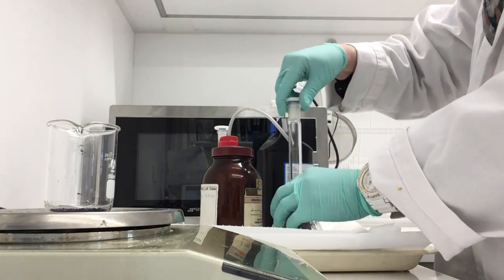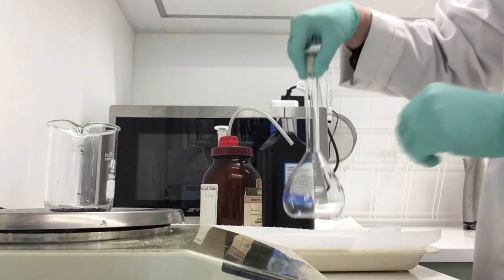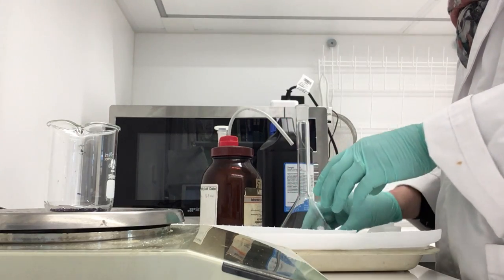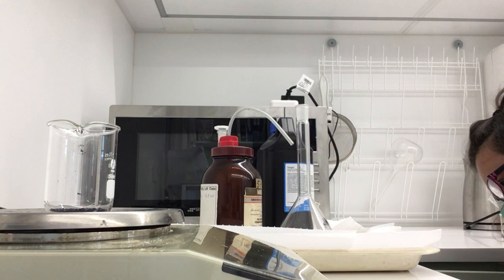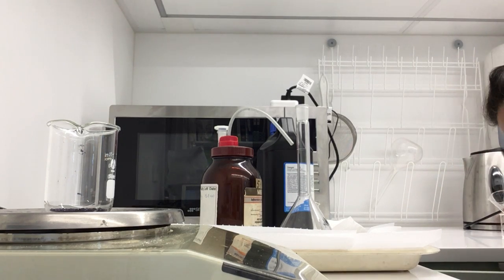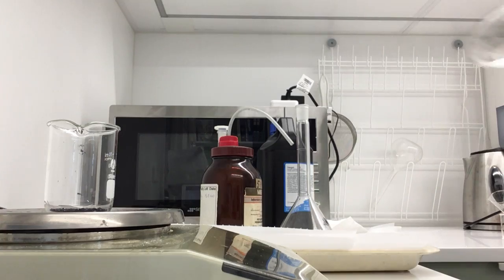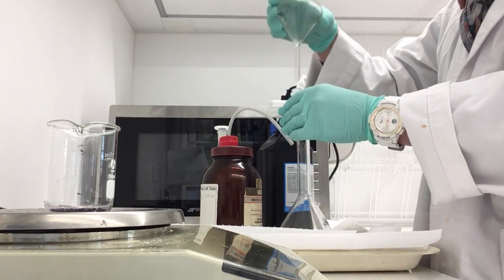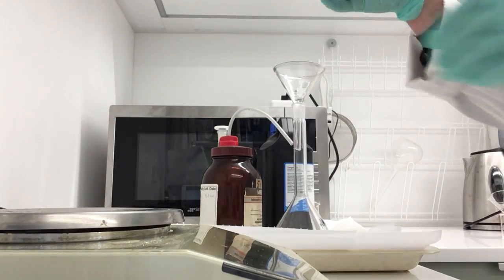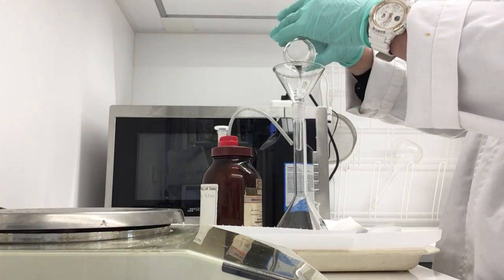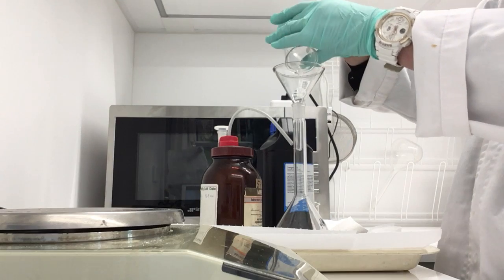So we're now going to put that into our standard volumetric flask. A little bit bigger, a small funnel. Okay, we'll use a funnel to make it easier for us, and we will pop in our potassium permanganate.